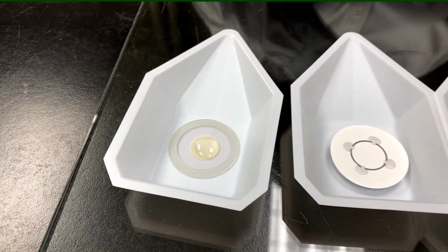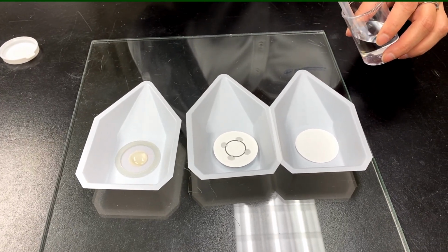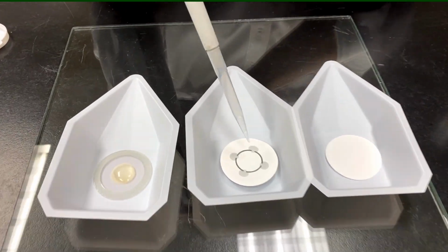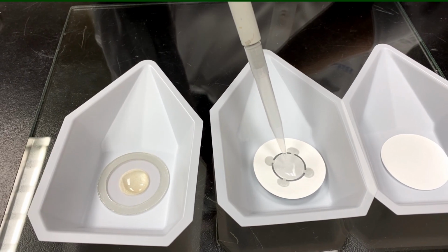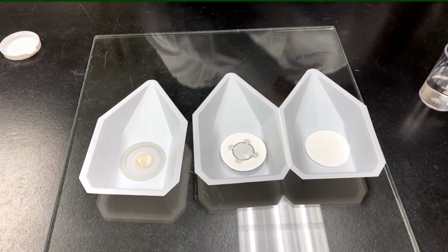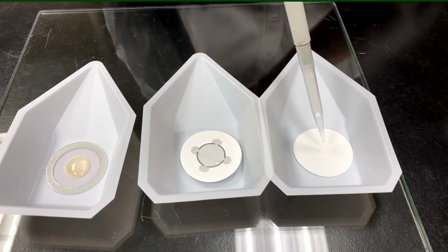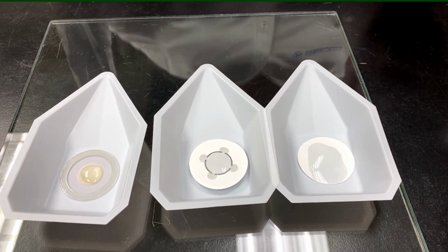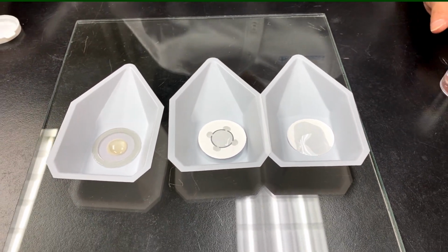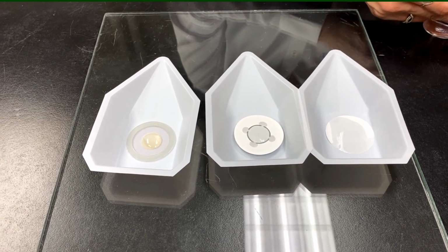Right. And by the way, we tend to use ICP standards, the liquid standards, to make calibrations with these. So you could make a direct calibration. We can also use them on our semi-quant program. There's actually a window in there designed just to run these types of filters. It lets you put in the volume, or a weight of the residual dried material, and then it will calculate the original concentration of the liquid based on that, and you can decide whether you want to report it as ppm or mass percent.